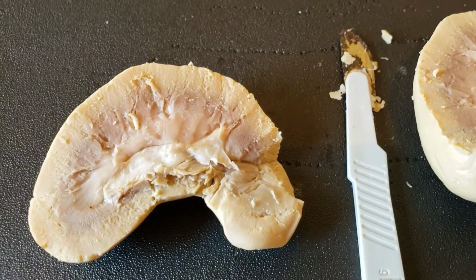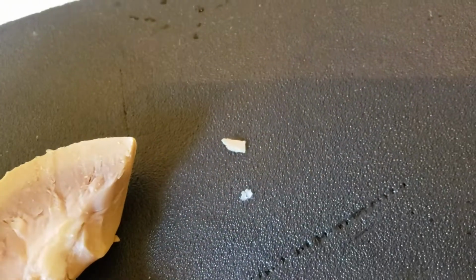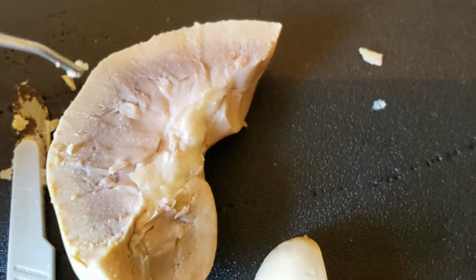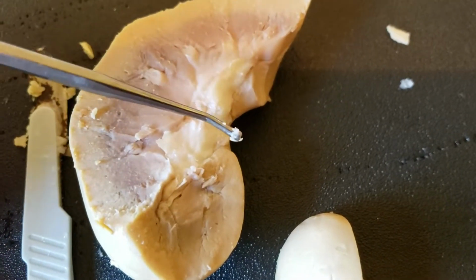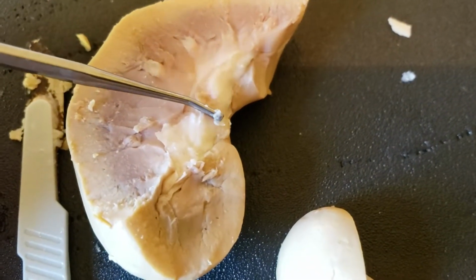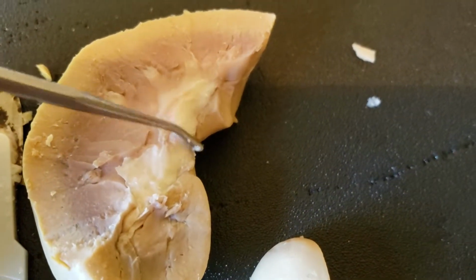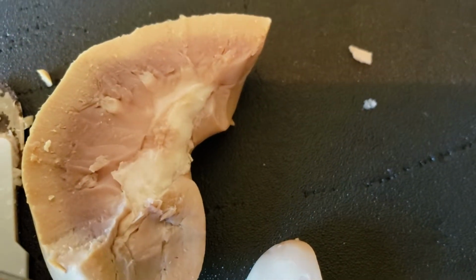So the renal pelvis is, okay, another thing where the dissection is kind of hard to do. I'm pretty sure I cut the ureter off when I was splitting it in half. And so the renal pelvis is also really hard to see. It would normally be right about here, kind of sticking out, and then a ureter would flow down to the bladder. But yeah, you can't really see the pelvis, which I don't know if it was my cutting it in half that made it bad. But the renal pelvis would be right about in here, and then out comes a ureter that would flow down to the bladder.